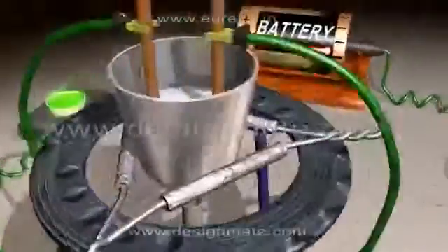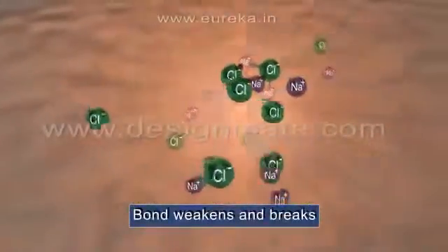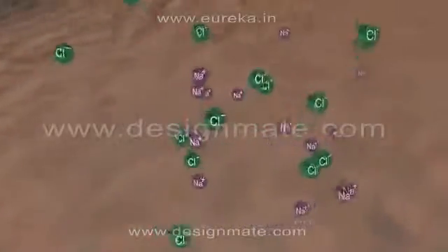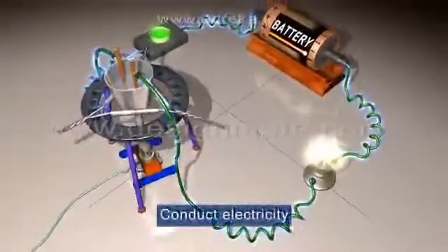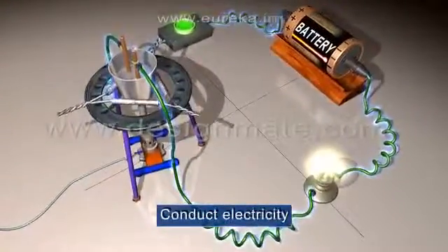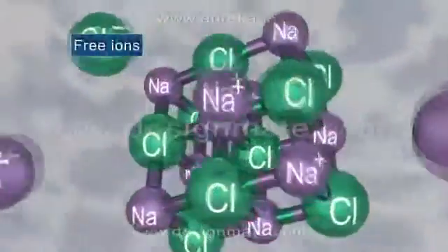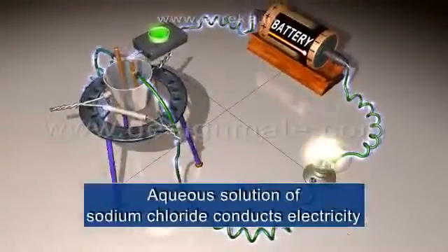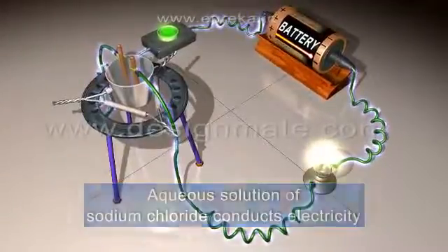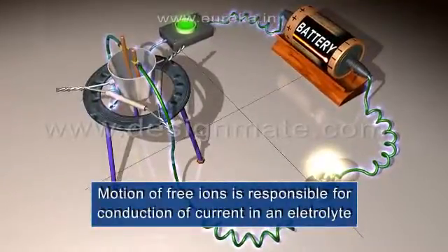When the same sodium chloride is heated, a bond between sodium and chloride ions weakens and breaks. The ions become mobile and are able to conduct electricity. Dissolving sodium chloride in water also produces free ions. Hence, an aqueous solution of sodium chloride also conducts electricity. Thus, motion of free ions is responsible for conduction of current in an electrolyte.